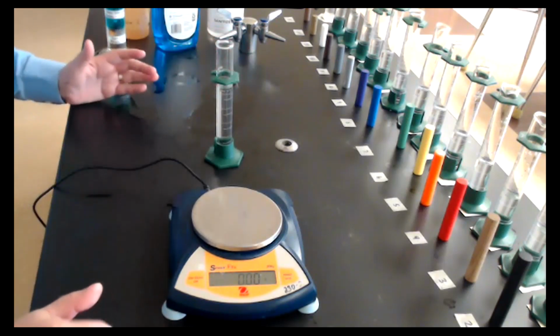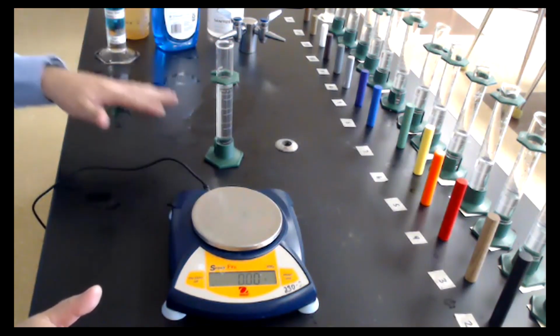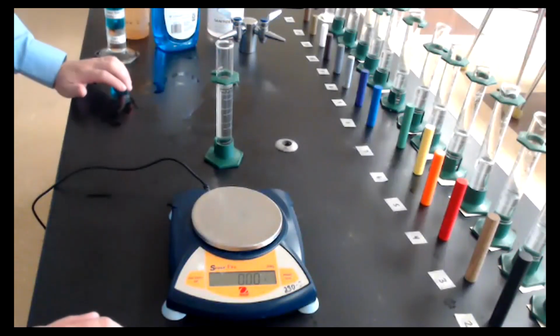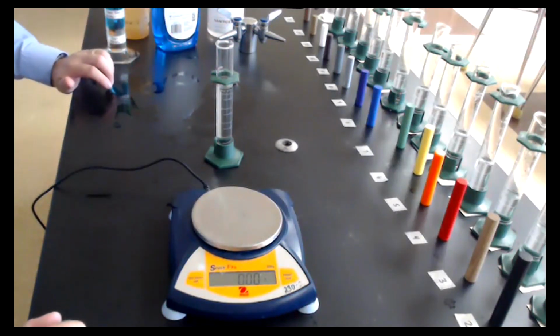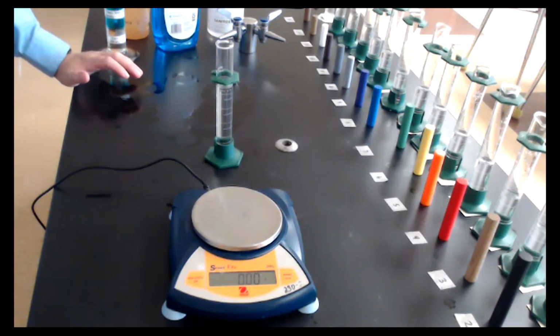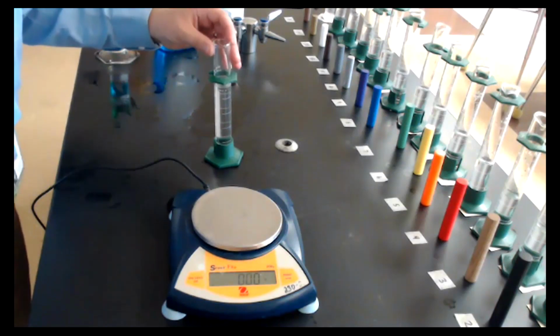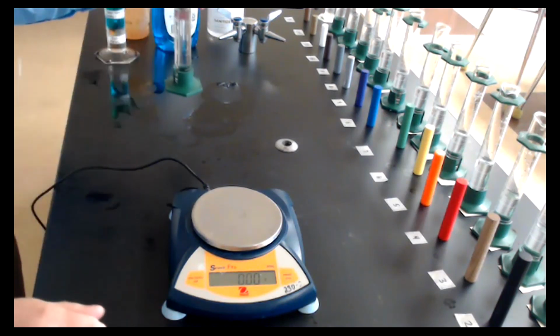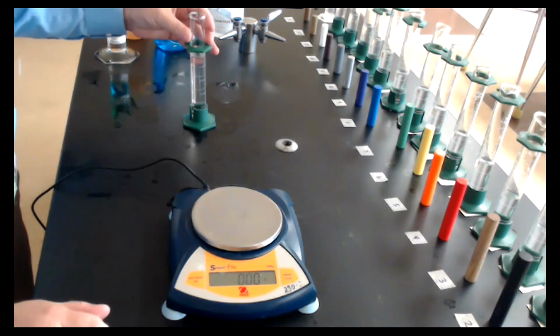Then I'm going to lower my body so that I'm at the height of the graduated cylinder and I can read it directly across. I'm going to read the graduated cylinder's volume as 47 point, and now that we know about significant figures, I'm going to read it as 47.1. So the total volume of the clear cylinder and the water that was in the graduated cylinder, we're going to record as 47.1 milliliters.